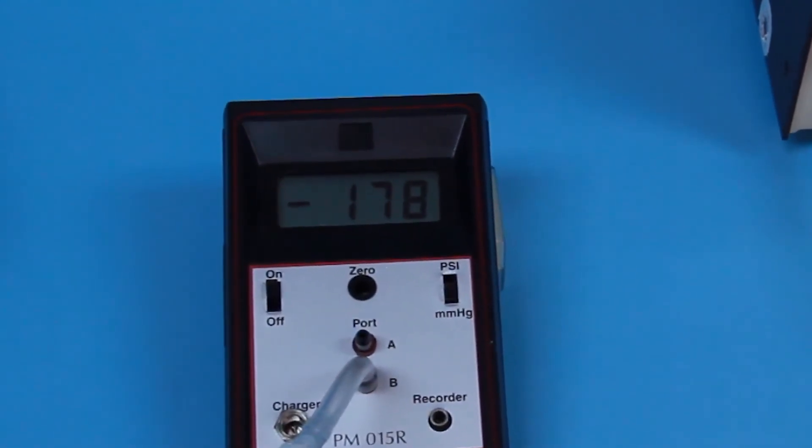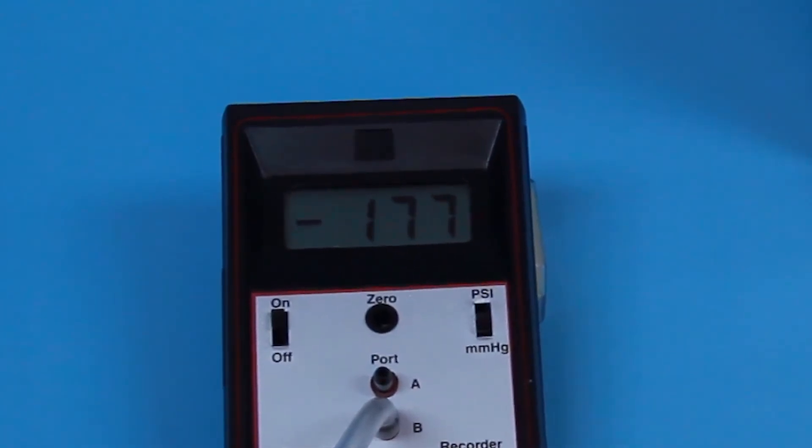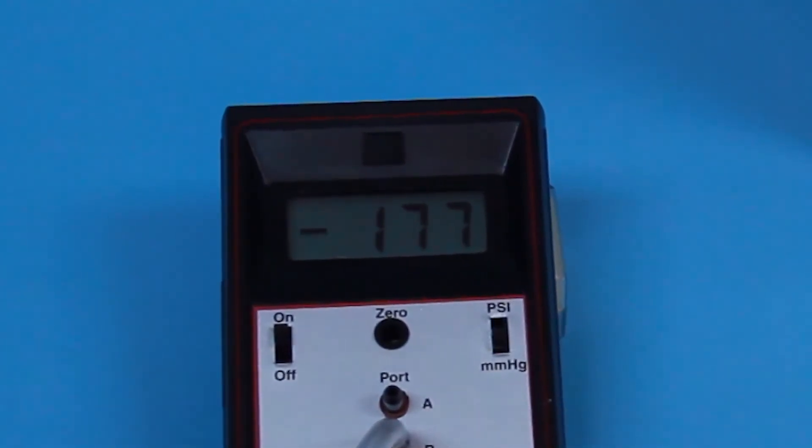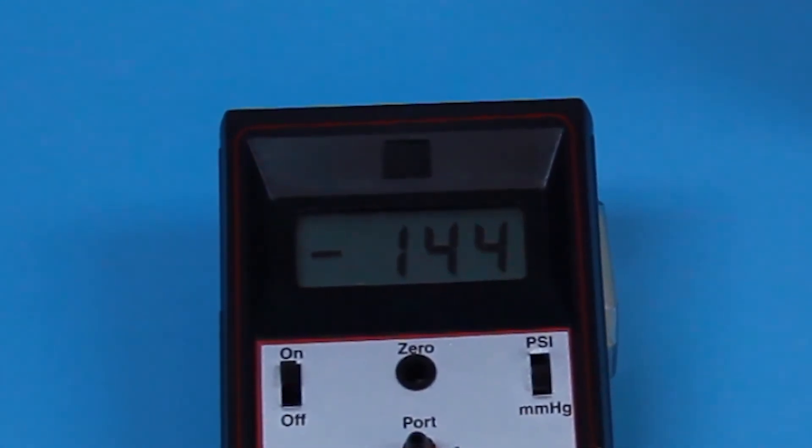The pressure and vacuum may be regulated to pressures other than our suggestion. However, it is crucial that the pressure side always be of a greater absolute value than the vacuum side and that there is a minimum of 75 millimeters of mercury difference between the pressure and the vacuum sources.